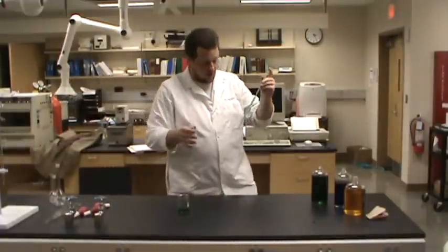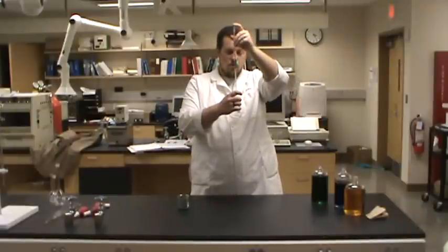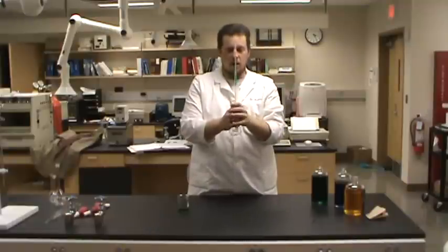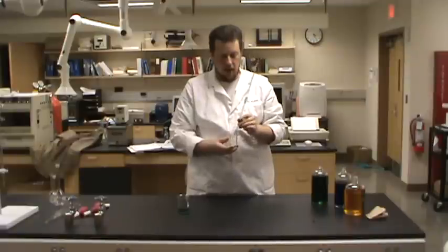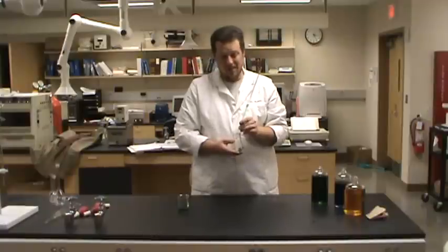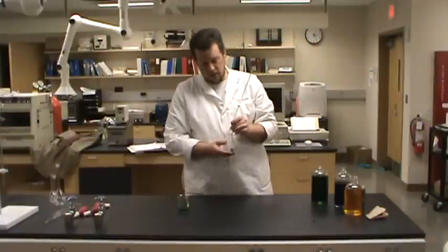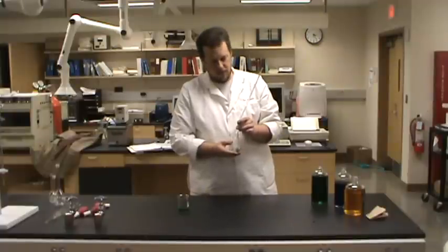So now I can take my finger off and we can let the liquid drain out of this pipette. And it's going to take a little while. And this one, it said about 26 seconds. So if we're at 20 degrees and it takes 26 seconds, okay.